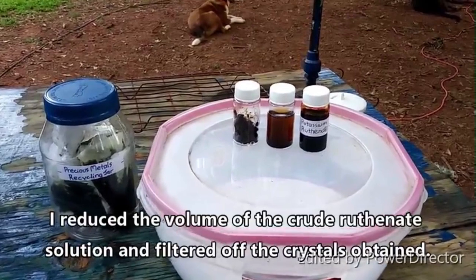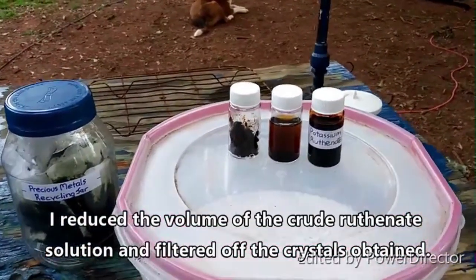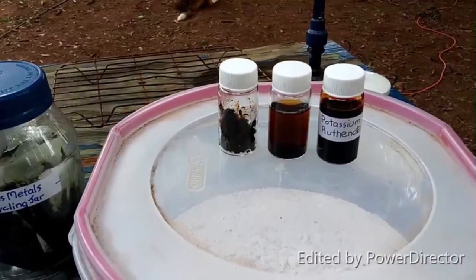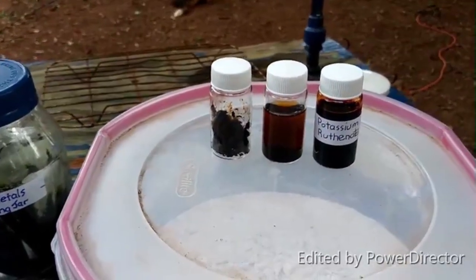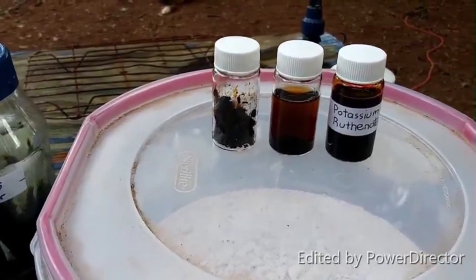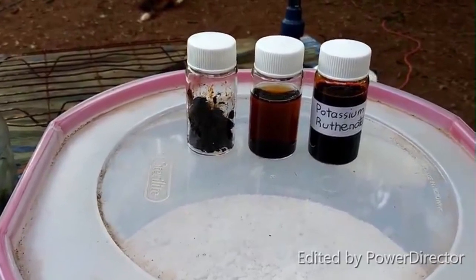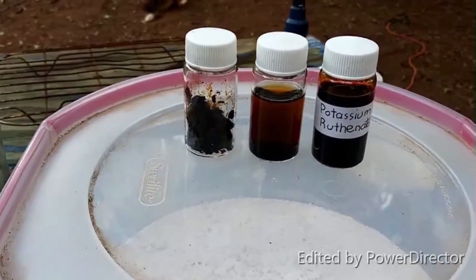After spending all night in the desiccator, this is what I've been left with the next day. What you can see on the right here are the two vials of the filtrate that I got from the crystallization and from the wash of the crystals, which was not very much — I tried to keep it to the bare minimum. I'm actually surprised that more didn't dissolve than actually did. It could definitely stand to be recrystallized, but what we've got right here — this is potassium ruthenate.